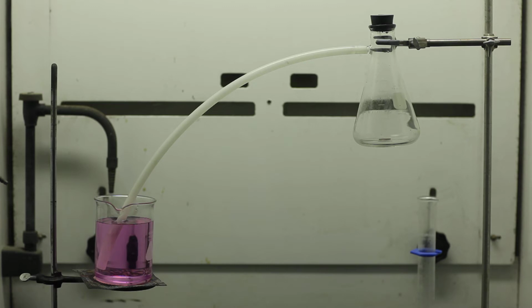In the interest of knowledge, I was even willing to sacrifice one of the few copper cents then in my possession. I put one of them on the table, opened the bottle marked nitric acid, poured some of the liquid on the copper, and prepared to make an observation."